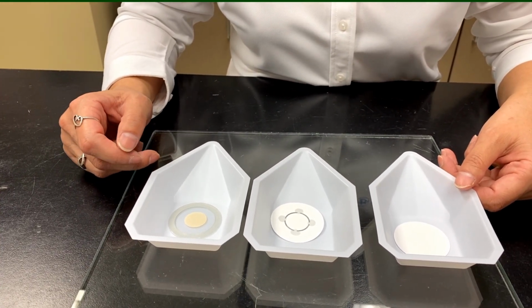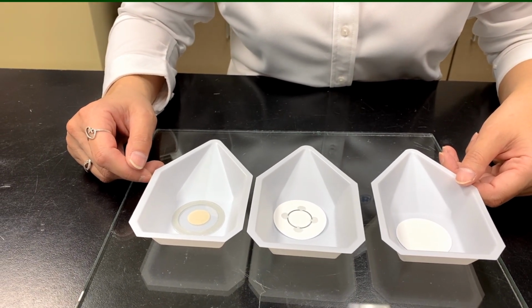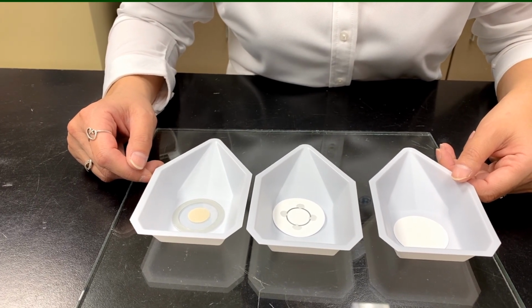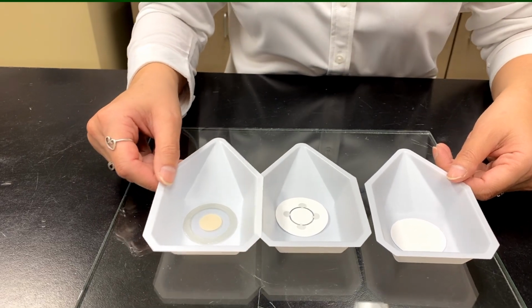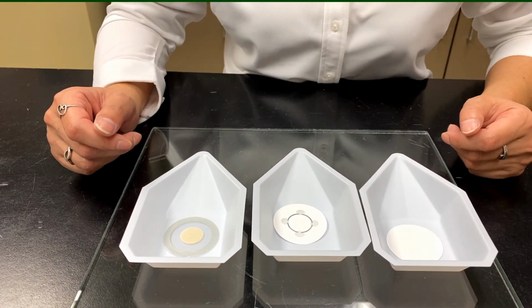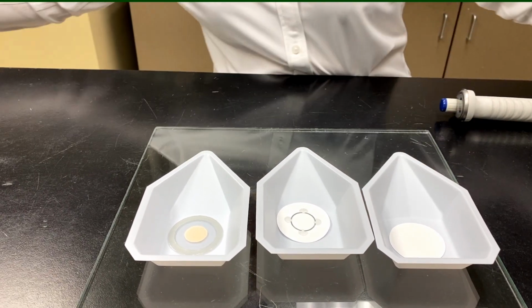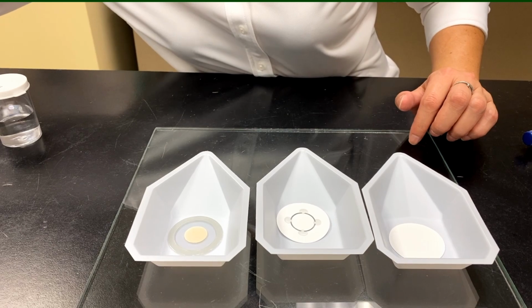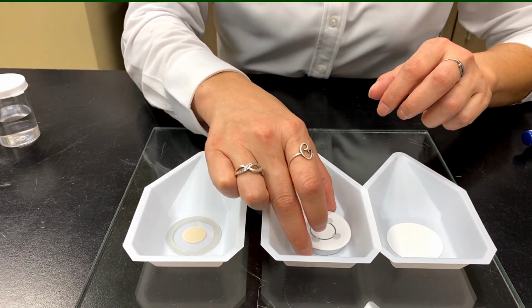Now, we can do liquids directly into those types of cups. So not the funnel one, but we have straight-walled cups with the film, prepared the same way, and you could do liquids straight into that. But what Tan's showing right here is we can actually dry the samples down and concentrate them, get better detection limits that way, and easily put them on the system, not worry about anything leaking, and run in vacuum, whereas liquids typically you can't do that.